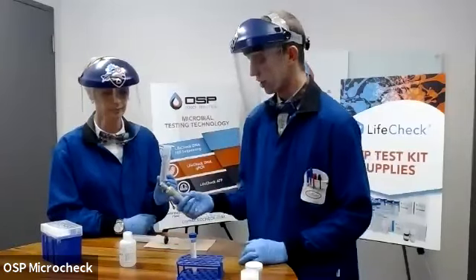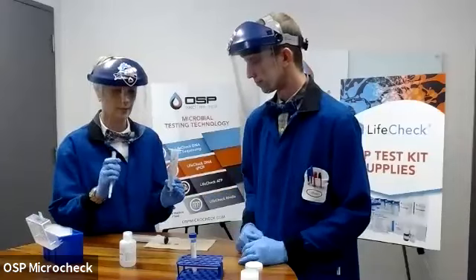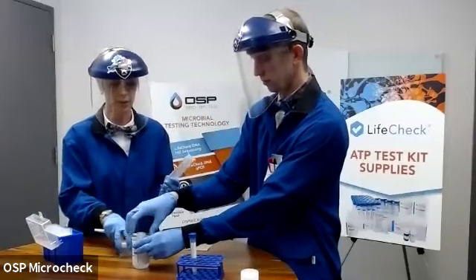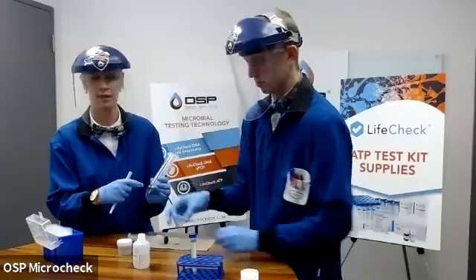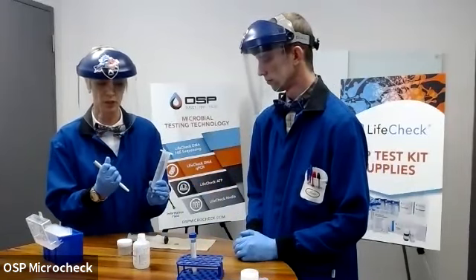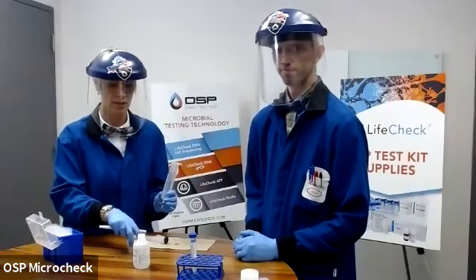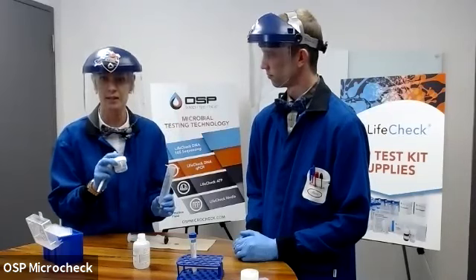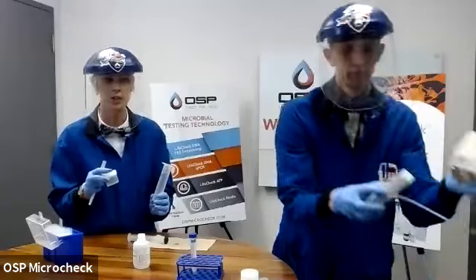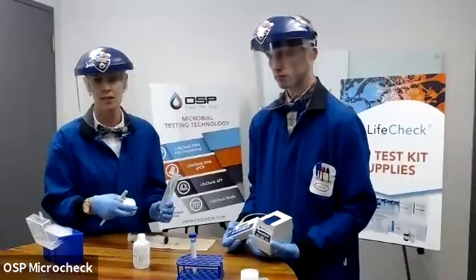And to do that, Virginia is going to use the brown 1 mil fixed pipetter provided in our kits. May I have my field container as well? Absolutely. So in this step, we don't want to put it to waste. This is where we're actually capturing that ATP. So there's two places where you can filter this last step into. The kits provide field containers. This is what I'm going to filter into. This is to allow us to stop at this step. And you can gather all of these within the field, put them into your cooler in your truck, and then take it back to the lab where we use the luminometer, or to a facility to take the reading.